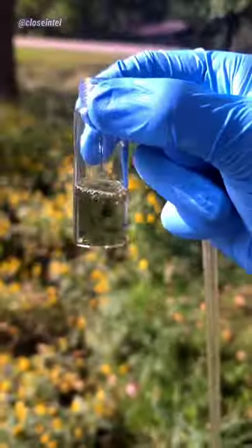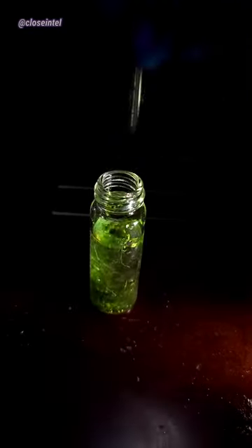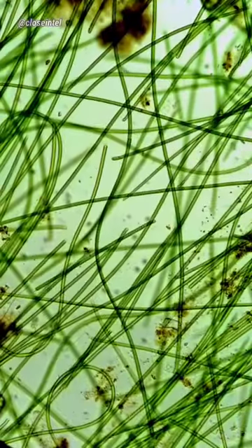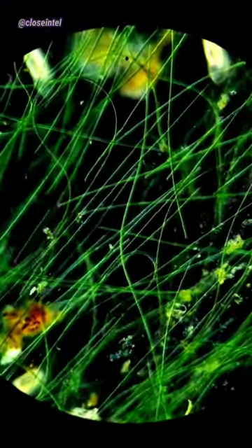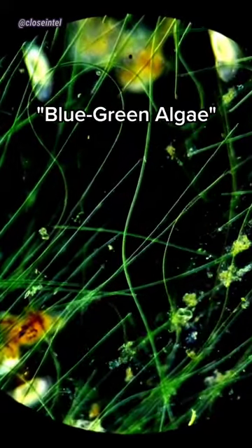Looking for samples at this pond, I collected some of this green goop floating on the surface to get a closer look. The green lines you see moving across the screen right now is actually a type of cyanobacteria, also sometimes referred to as blue-green algae.